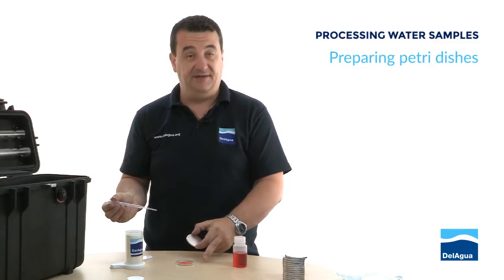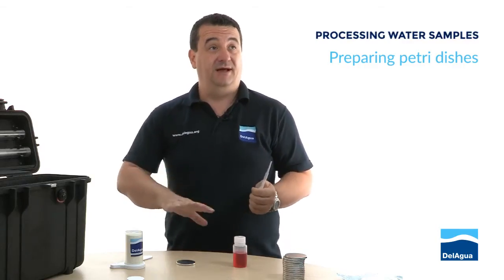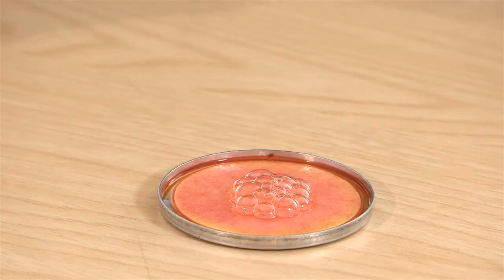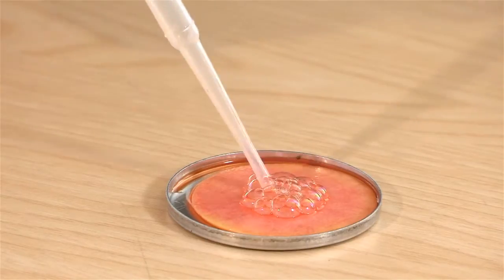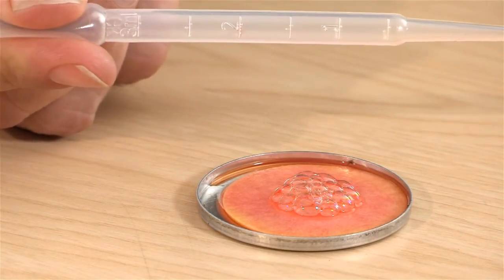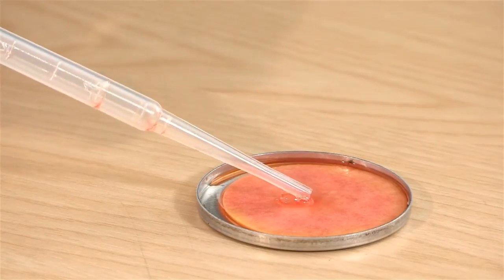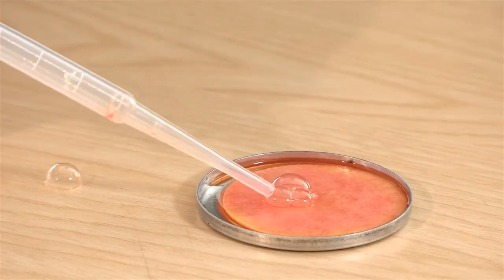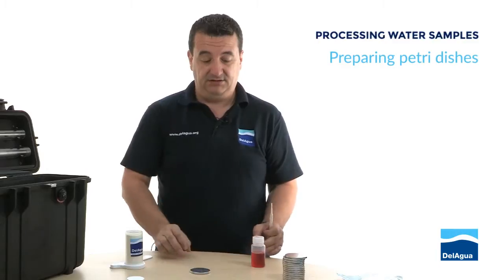Apply the media in a circular motion so there's complete saturation - it's starting to soak around the edges. What happens if there are bubbles? Bubbles are no good. Bubbles create a barrier between the membrane and the food, and you won't get the bacteria growing, which will cause a problem with the result. If you end up with bubbles, there are two ways to remove them: stab the large ones with the end of the pipette, or squeeze the pipette end and suck the bubbles out much like a vacuum cleaner - squeeze again and suck them out until you're bubble-free. That plate is now ready for the membrane.